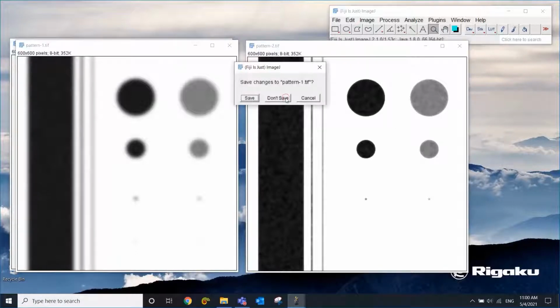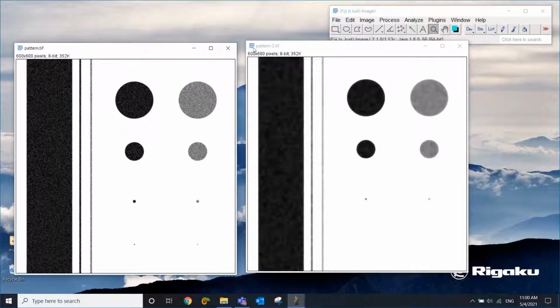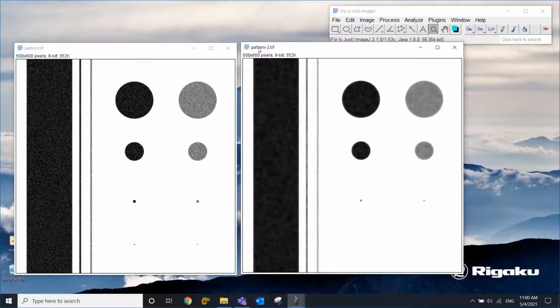Now, this is probably a good point to think about this question. So why are we doing this smoothing? In most cases, you do this to make it easier to do the image segmentation. Let's say that we want to segment this original image into black areas and everything else.